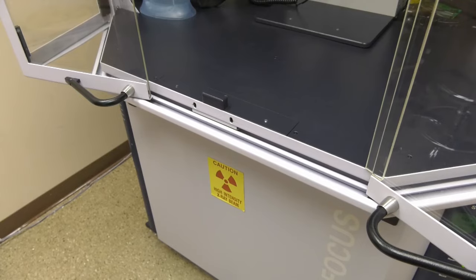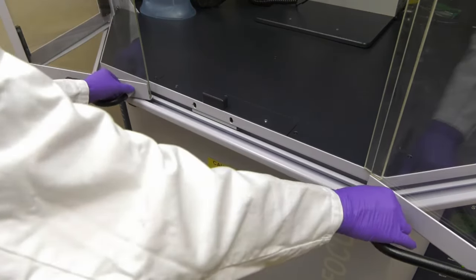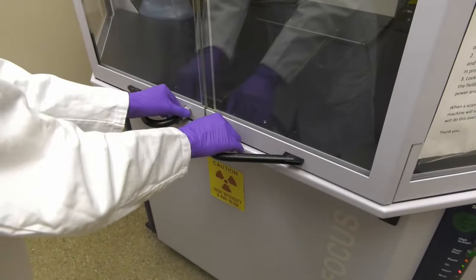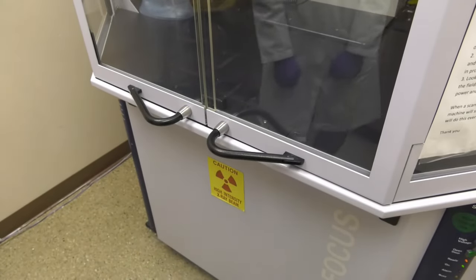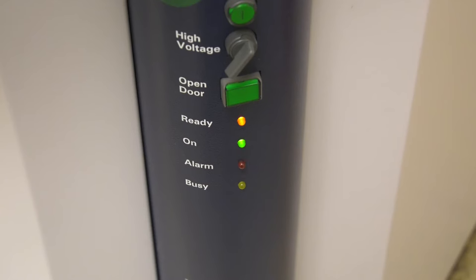The doors are closed by gently sliding them together by the metal fixtures, and then locked by pressing the black handles in simultaneously. When the doors are locked, the alarm light will stop blinking and remain off.